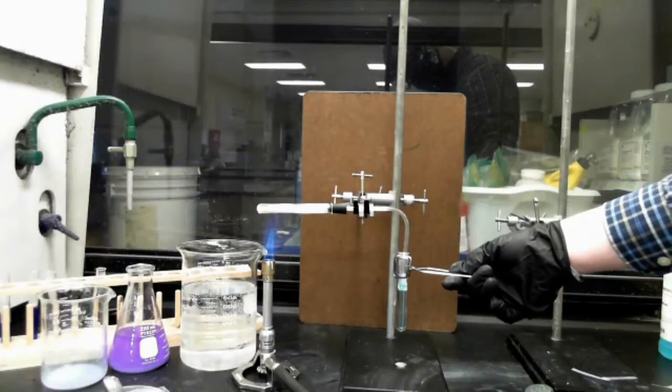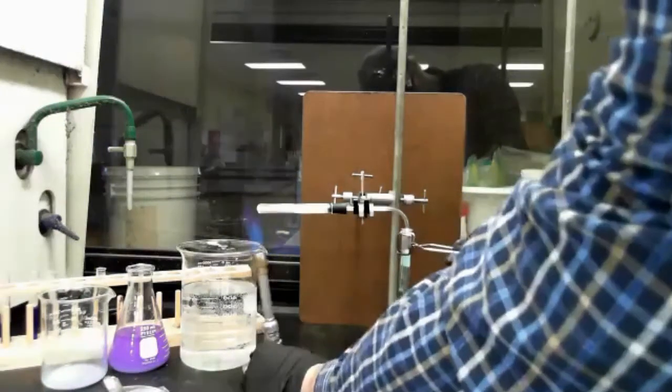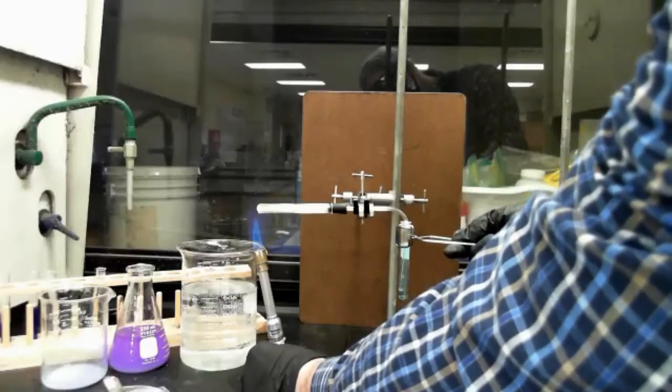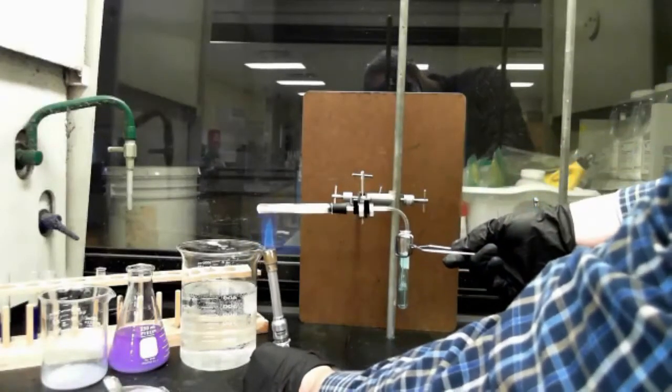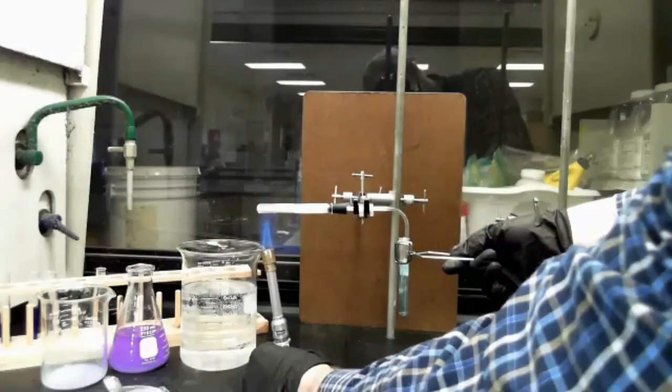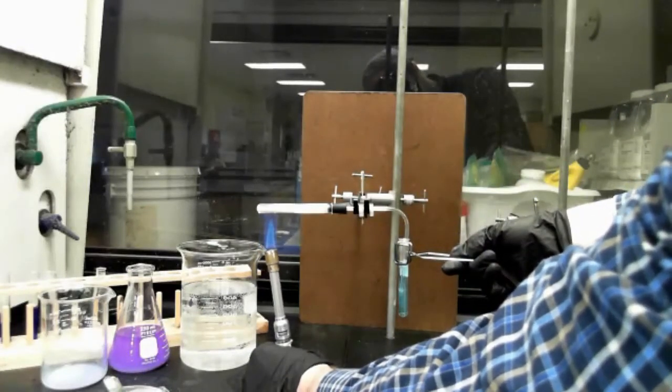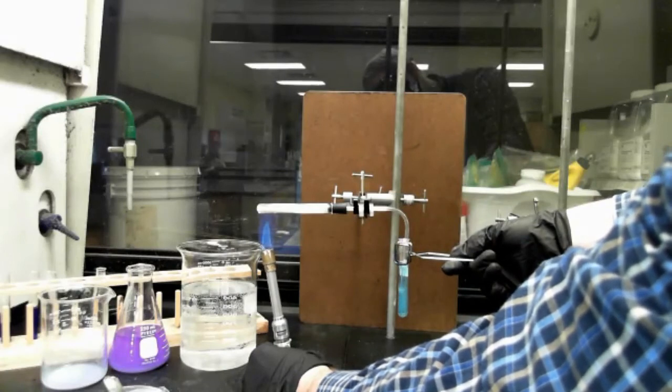But hopefully we can keep this well and continue to generate some. So I see we're still having some trouble with that.